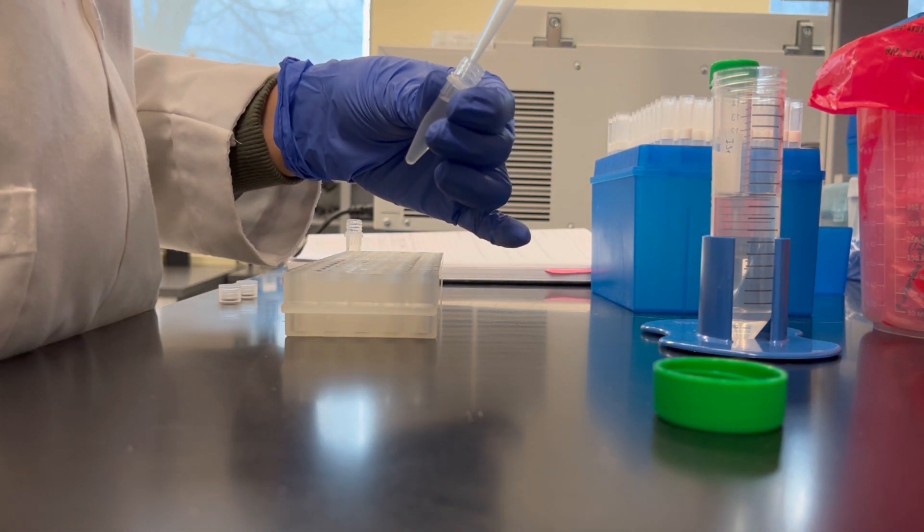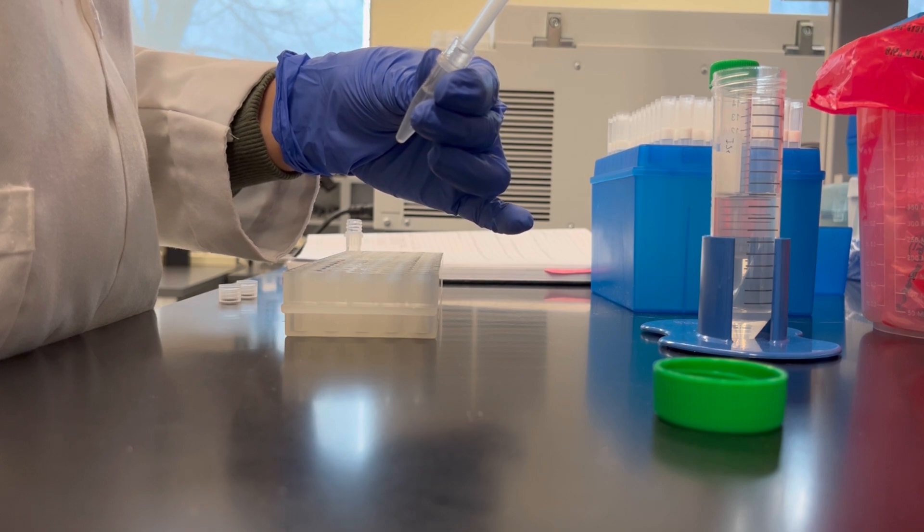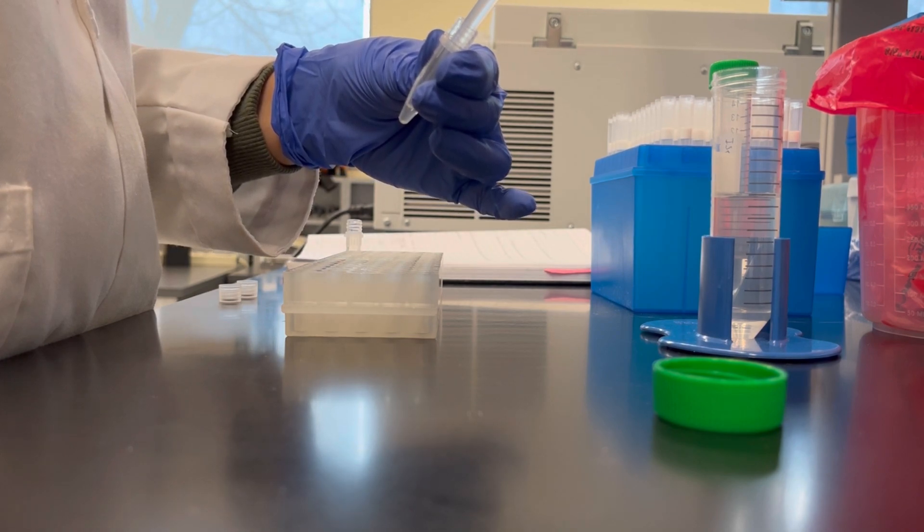Remove the isopropanol as much as you can and throw it away without touching the white pellet which is the RNA.